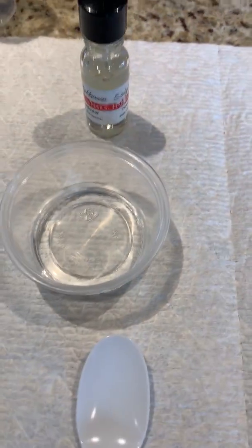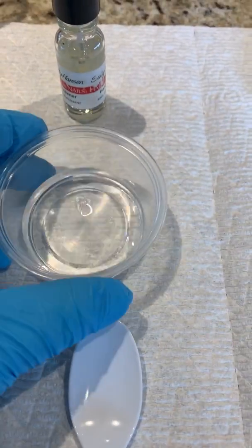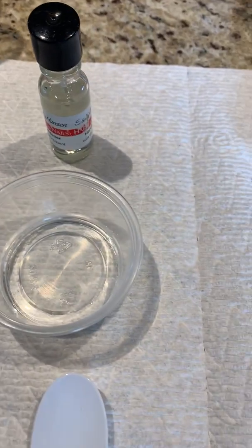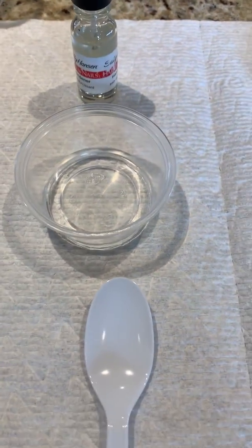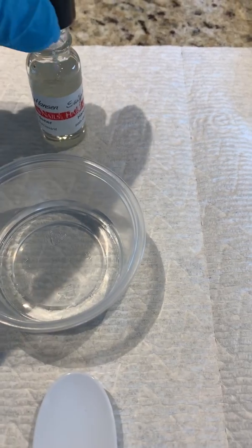All right, in this example, what I'm going to use is the 25 mils of water, pre-measured out via volume, with RO water.